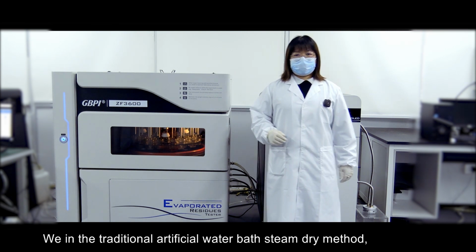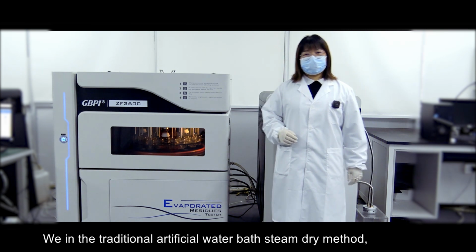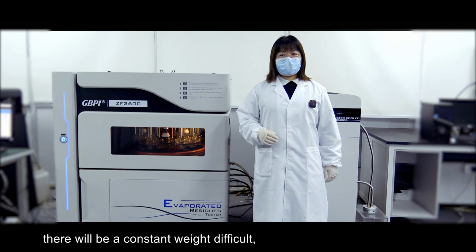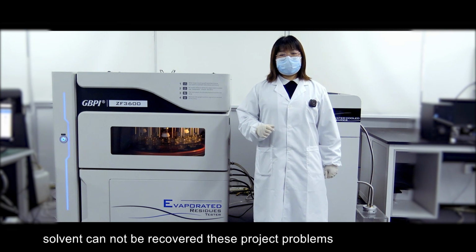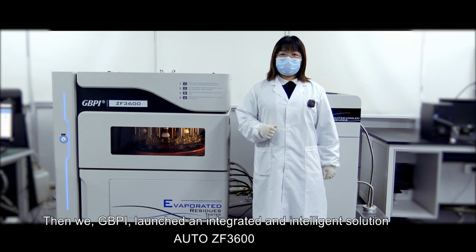The traditional manual water bath steam dry method has these problems: constant weight is difficult to reach, the operation is cumbersome, test efficiency is low, and solvent cannot be recovered. So we, GBPI, launched an integrated and intelligent solution, Auto ZF3600.